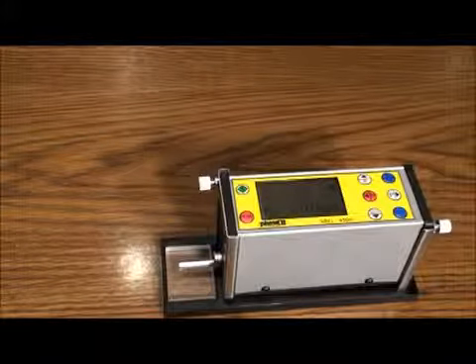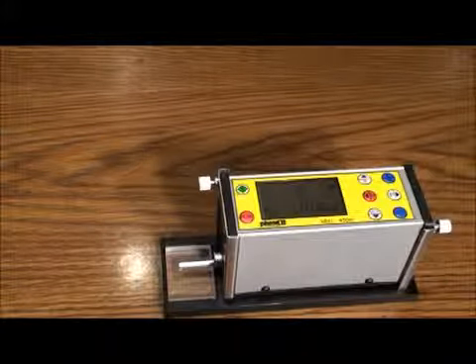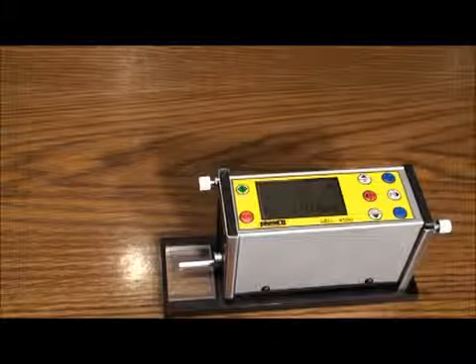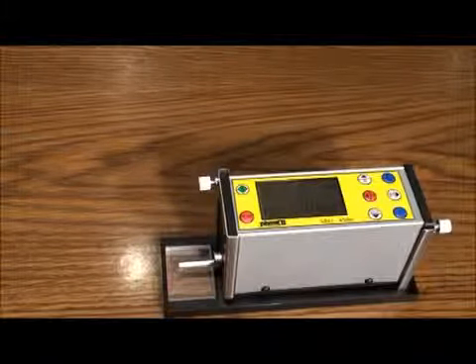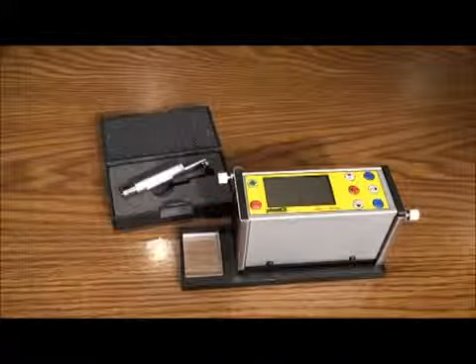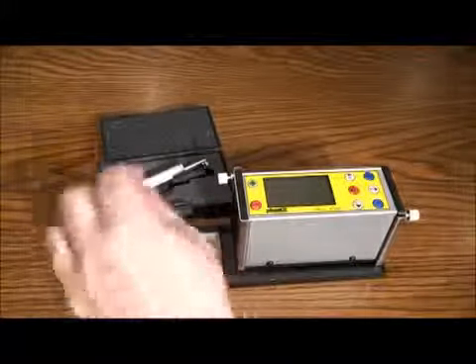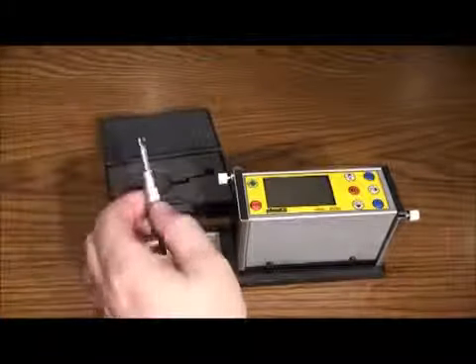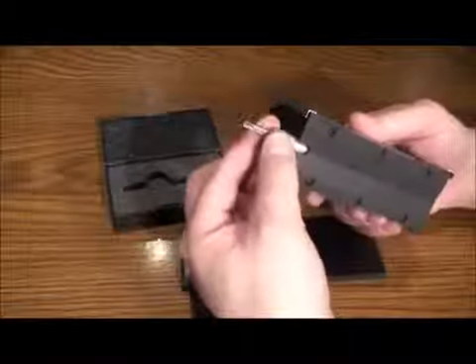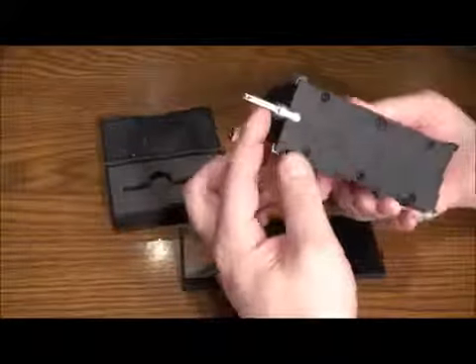As you can see, the SRG 4500 is a handheld battery-powered instrument with graphic display and controls on top and an extended stylus which will retract and extract upon taking surface roughness samples automatically. To begin, insert the stylus that is supplied in a separate container for optimum protection. Make certain to line up the plug and press easily into the socket.